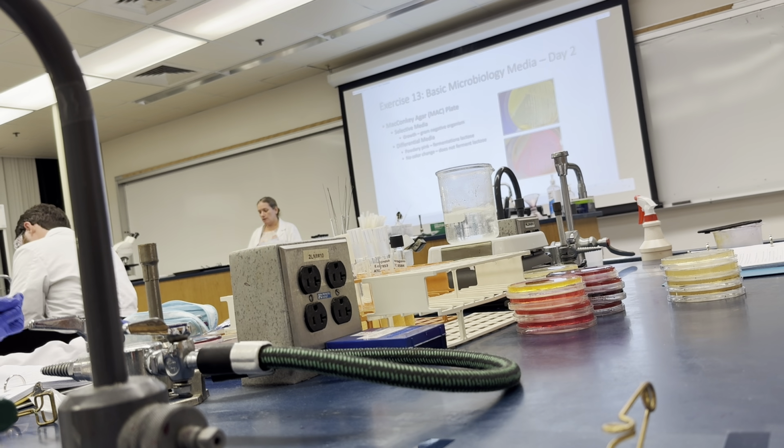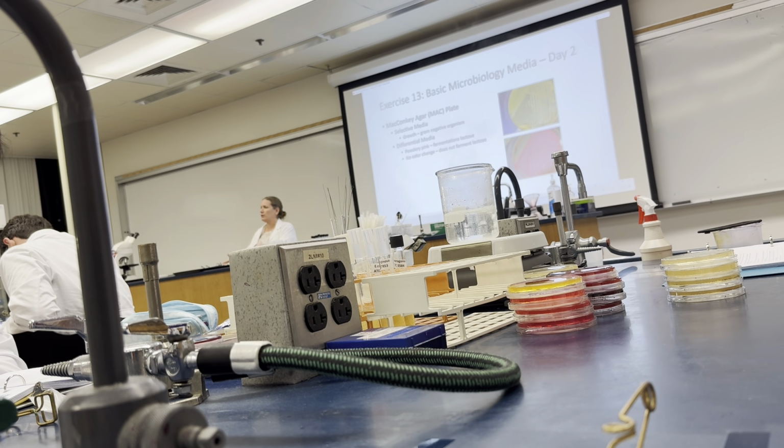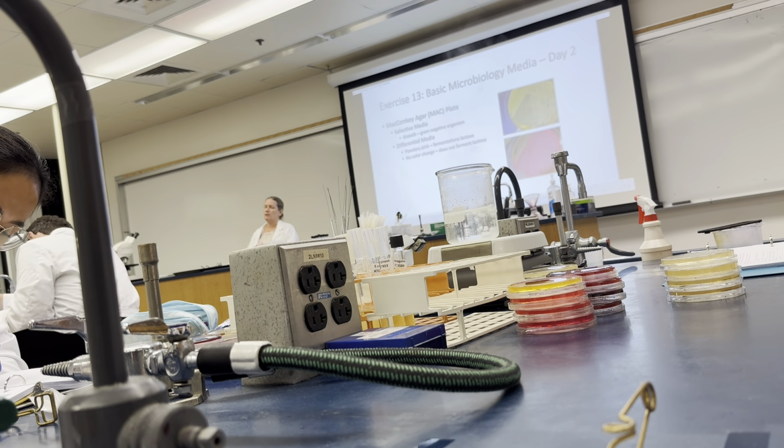Not, what did Salmonella do on this media? Okay, I'm not gonna ever ask that. Or am I gonna show you a plate and say, what organism is this? No, okay? I can show you a blood agar plate and say, what type of hemolysis pattern is this? You need to be able to differentiate the 3 hemolysis patterns. Okay, does that make sense? So don't get tripped up and locked up in organism names. It's not what this is about.